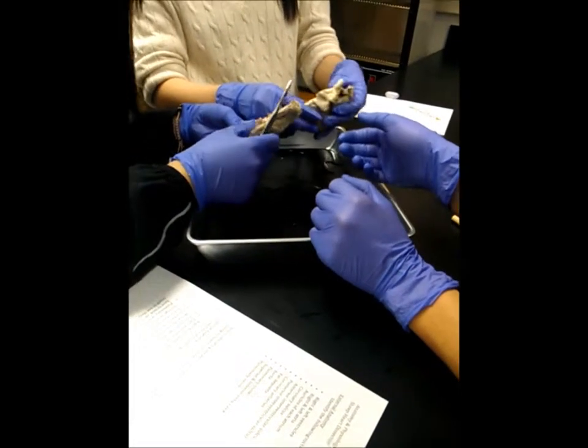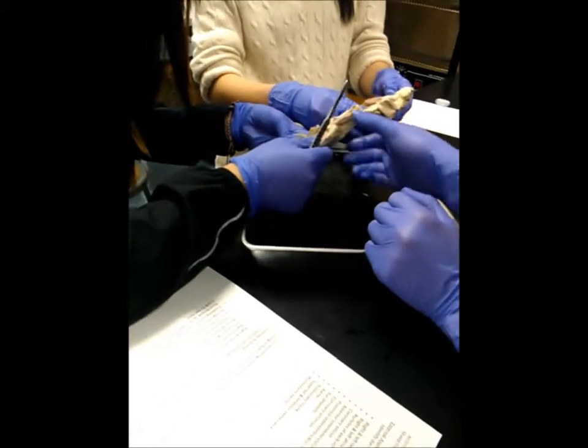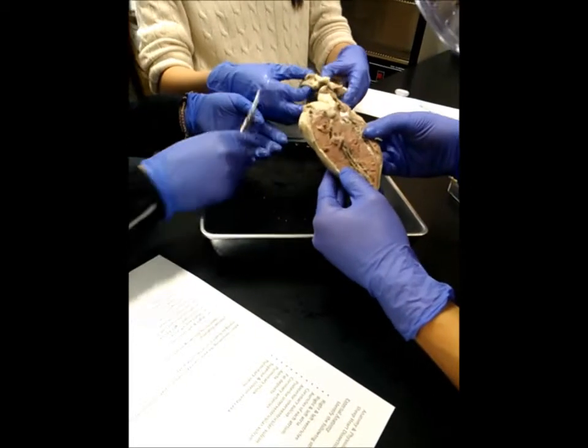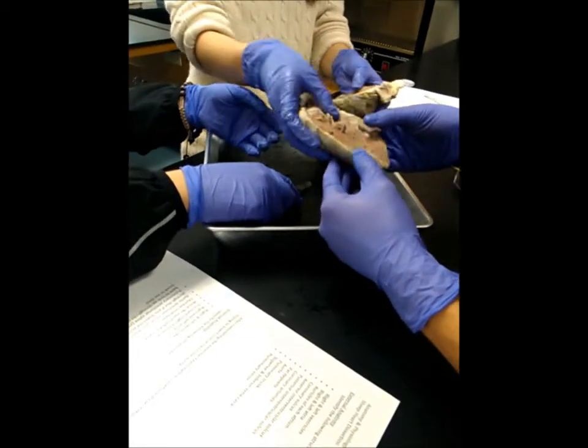It looks like the entire heart. See, it looks like meat, it does.